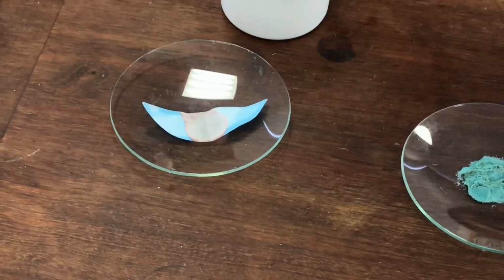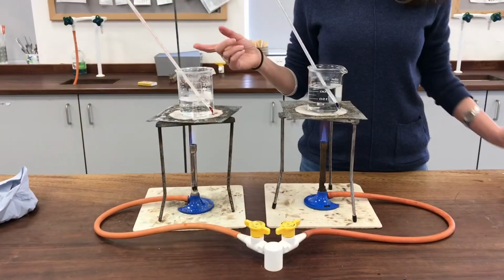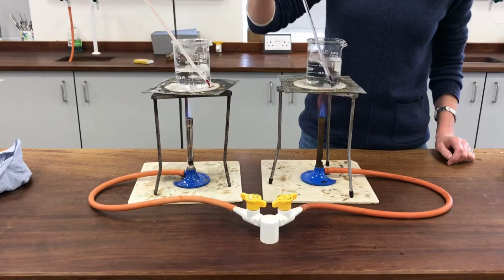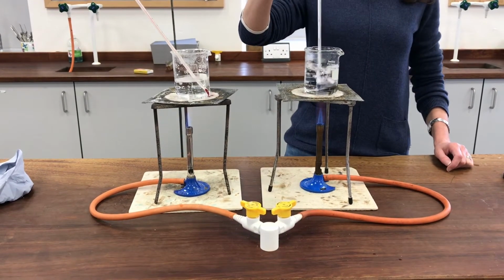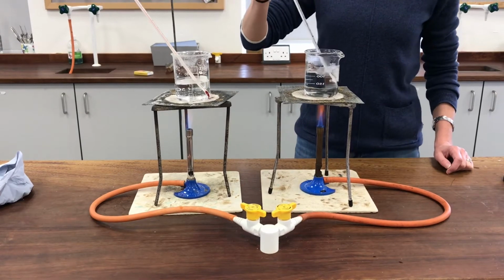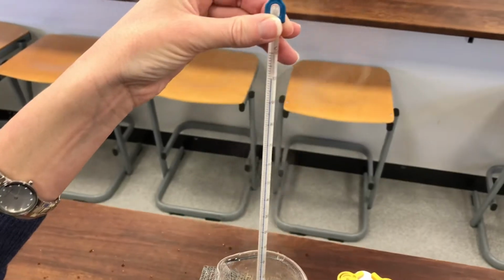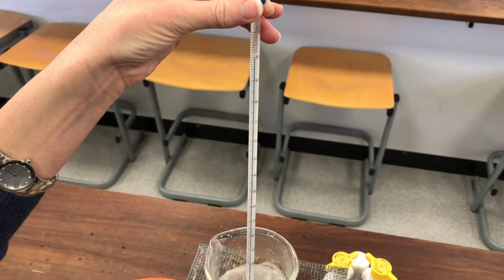So we'll go back and have a look in a moment at our boiling water samples. Because the water is boiling now, I'm just going to take the temperatures so I can tell you. Now this one, my pure water, is on exactly 100 degrees C, as we expected, because pure water does boil at 100 degrees C. So this is the pure water. You can see the scale's gone up to exactly 100.